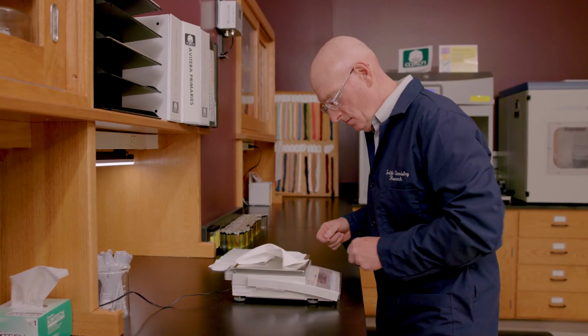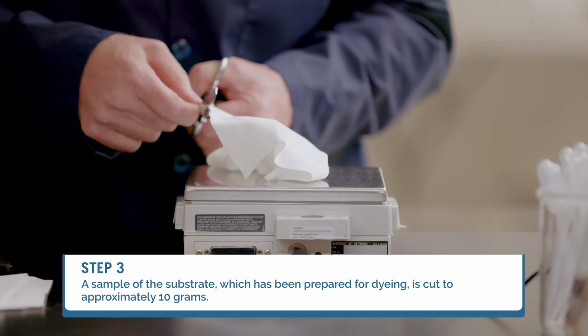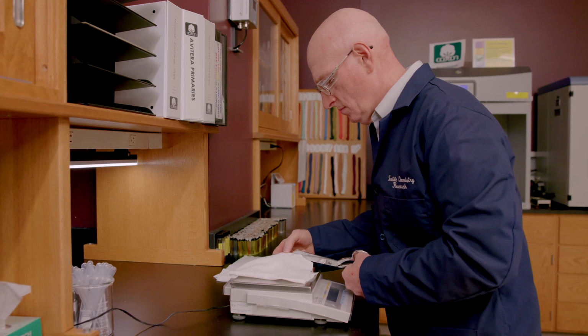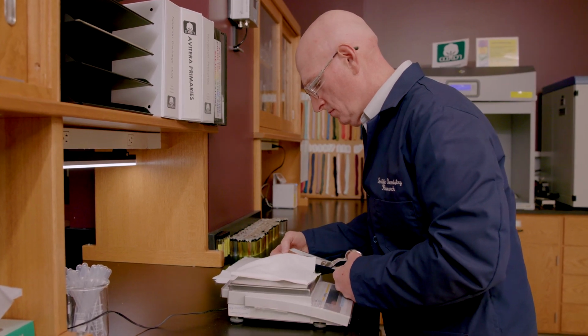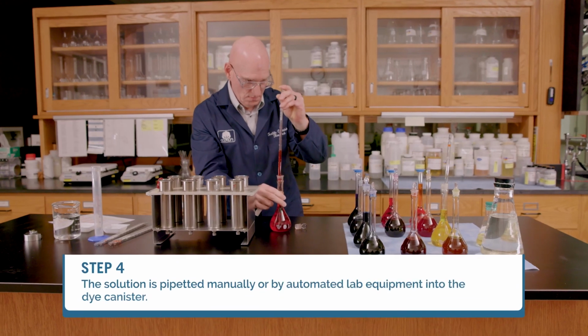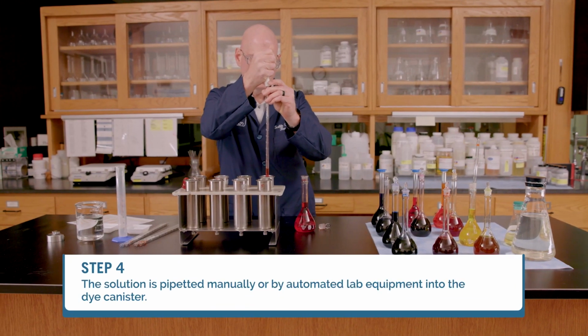A sample of the substrate, which has been prepared for dyeing, is cut to approximately 10 grams. Due to the minuscule amount of dyestuff used, they must be dissolved in solutions of water to allow for accurate measurement. The solution is pipetted manually or by automated lab equipment into the dye canister.